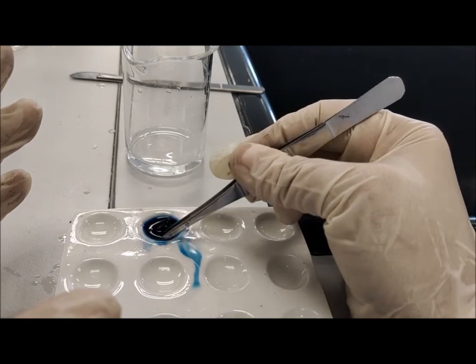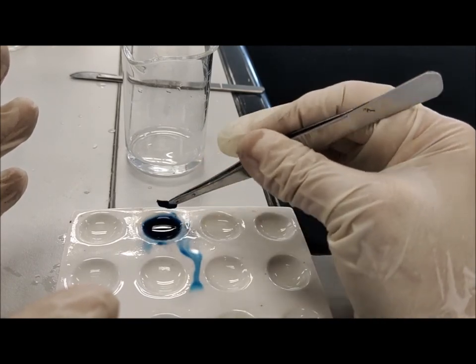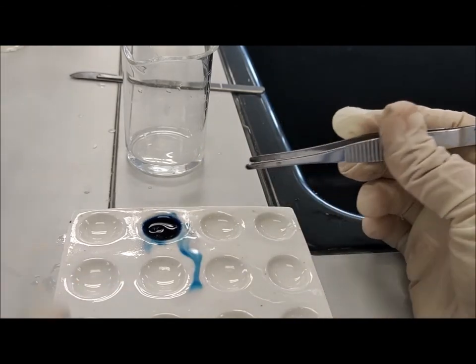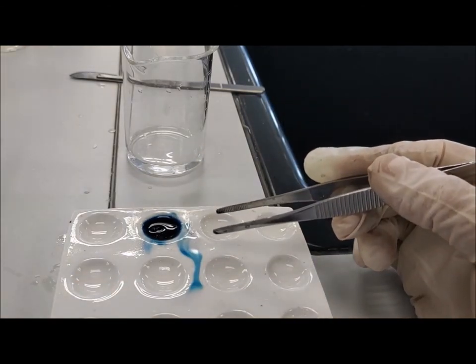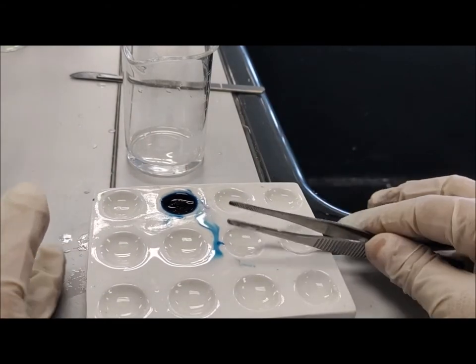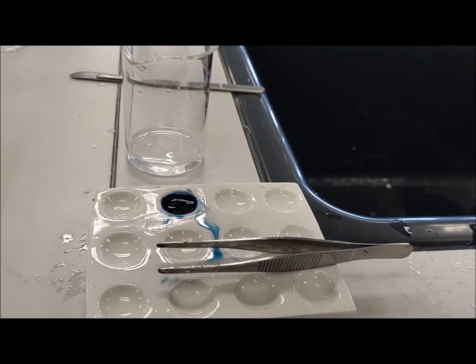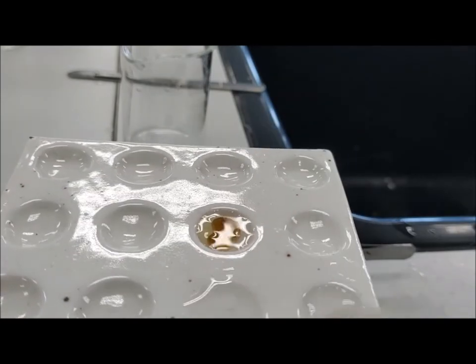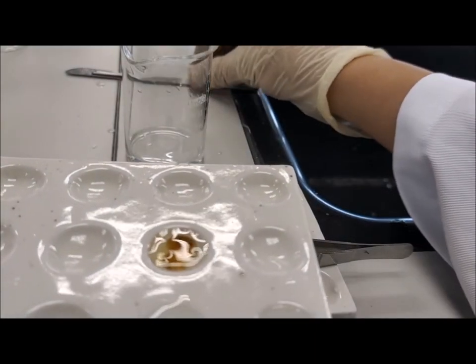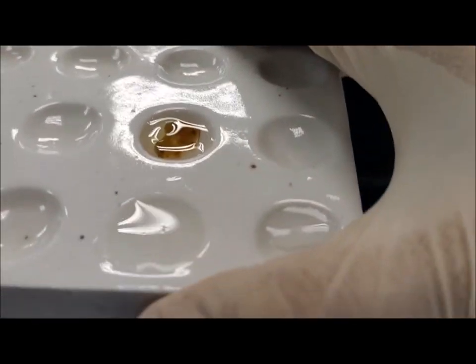Like the cell wall, it can be identified easily under the microscope. I just leave it here so once it gets prepared, it should be in the stain for five to ten minutes. After that, I wash it and go to prepare the slide for the specimen I have prepared.